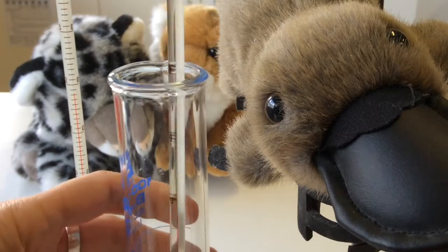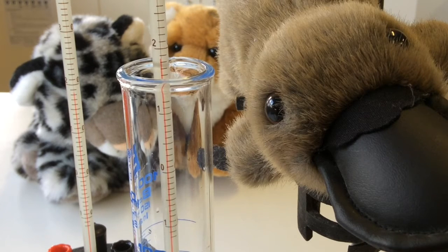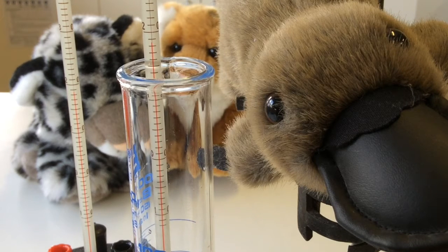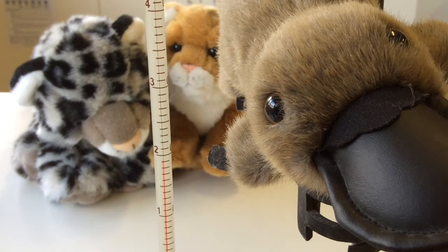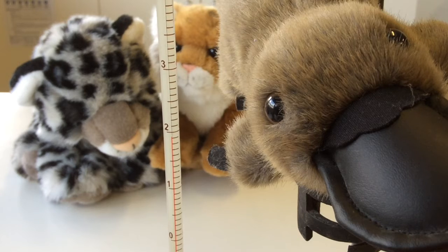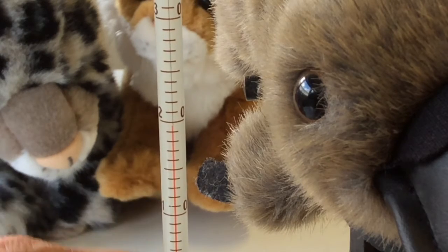Now the other thing I needed to do was measure the temperature of the sodium hydroxide. So I've got the bulb sitting in the liquid. You can see the scale. There's a 10, there's a 20. So what temperature are we sitting on? Sodium hydroxide. What temp? Your hydrochloric acid should be theoretically around about the same temperature. It's a little bit higher, but the thermometer may not be calibrated properly.